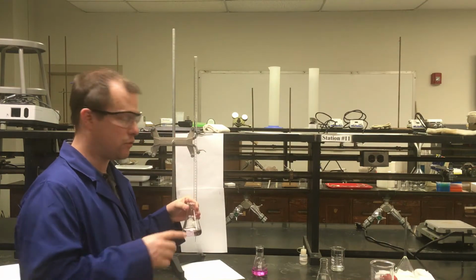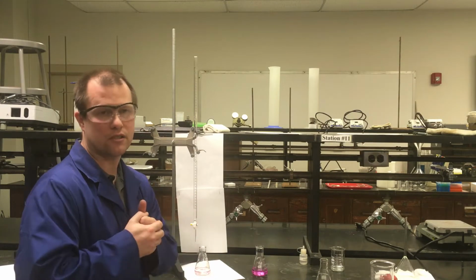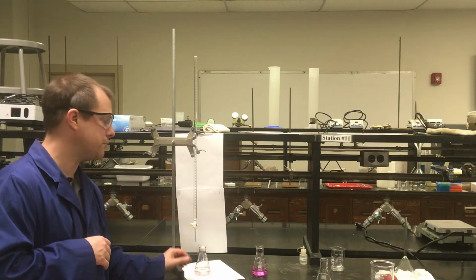It's a big part of why I have the white paper in the background. If you're doing titrations that have visual indicators, sometimes it's a good idea to do them on top of a white sheet of paper. It's easier to see the color distinctions if you do it that way, and that's why I have that there. So that's the goal. We're going to aim for doing a titration that ends hopefully looking something like this.